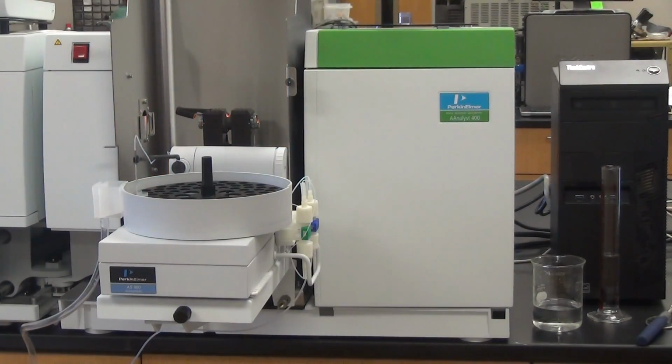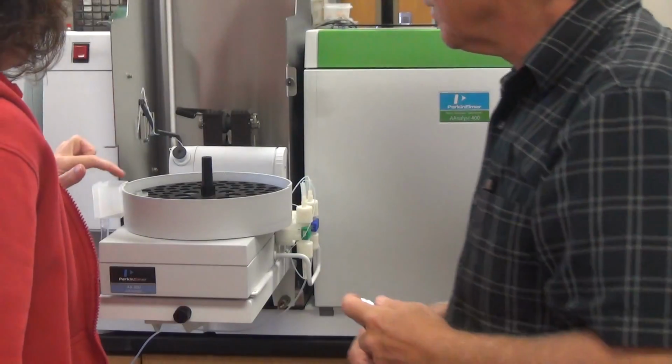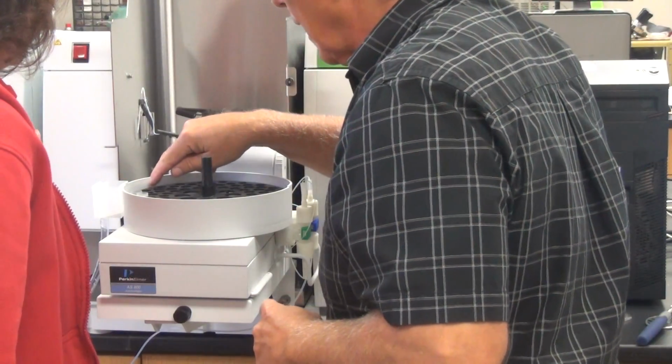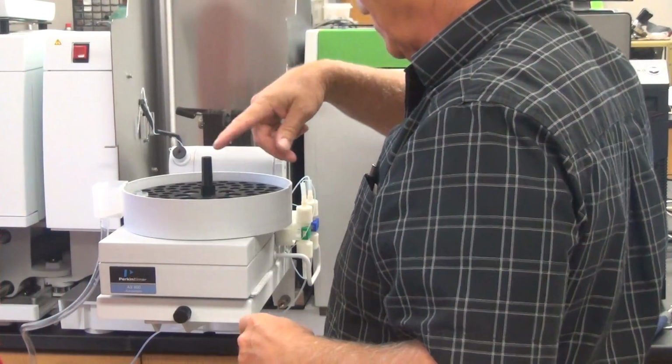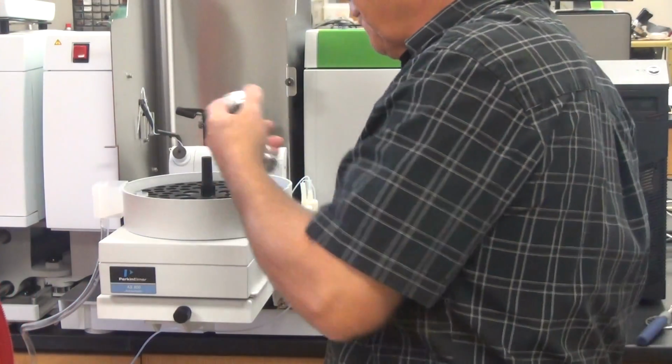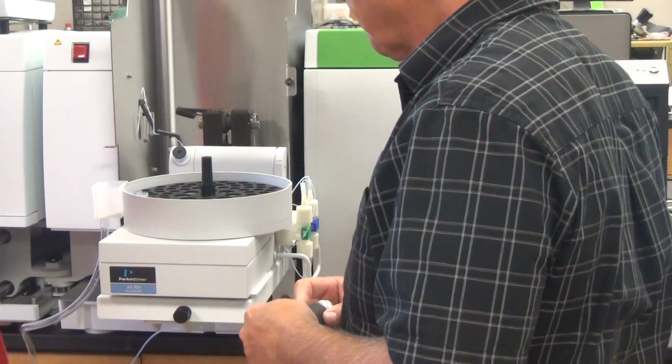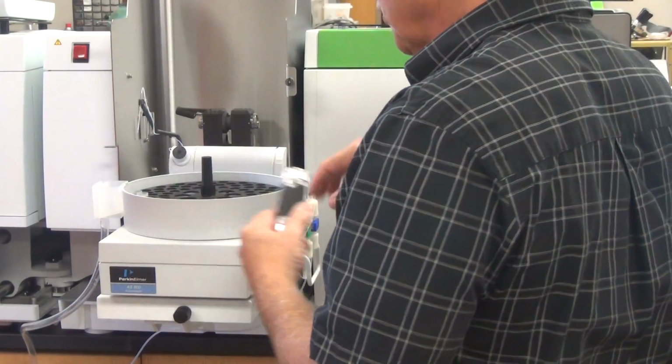So the auto sampler, station one, no matter how you have it, station one is always there, or will it spin? It will spin. It will move. I happened to choose station one, but if I would've said 41, it would have gone to the other. Yeah, it moves to it. Okay.